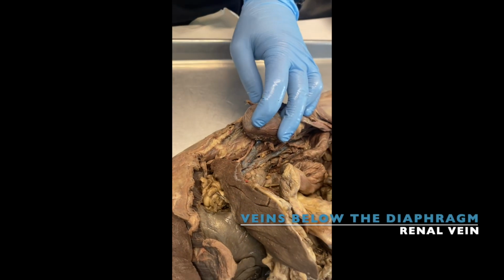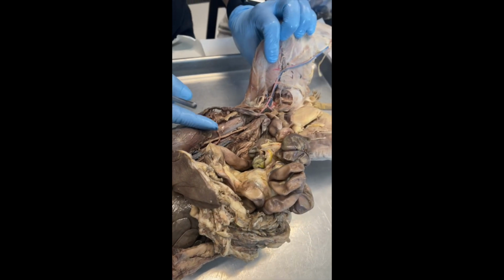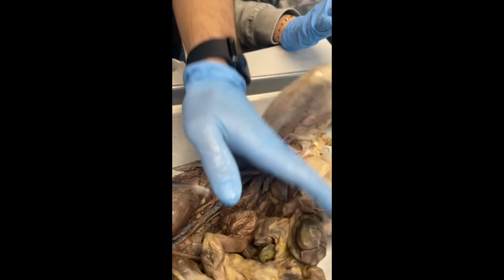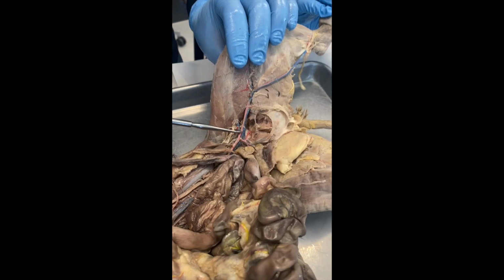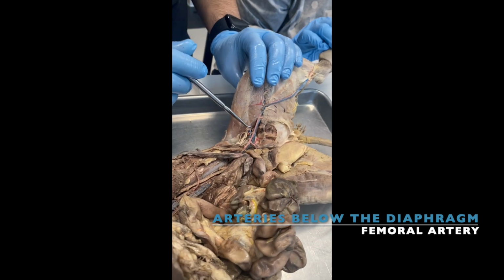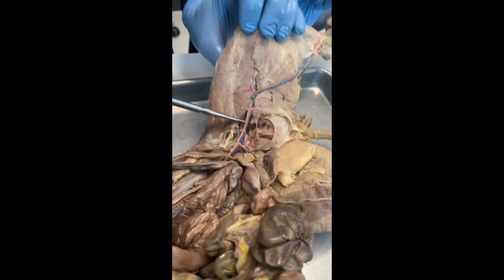Arteries always run parallel with the veins. Very good. Keep going down, passing your abdominal cavity. So abdominal cavity finishes here. Going to your leg. Guess what's the name of this? Femoral. Very good. Right? You have the femur in your leg. So you have the femoral artery.